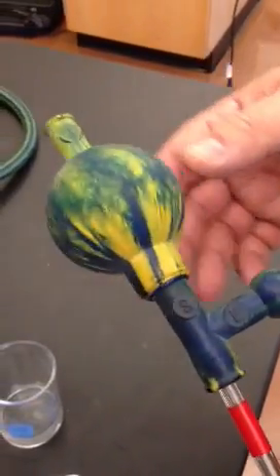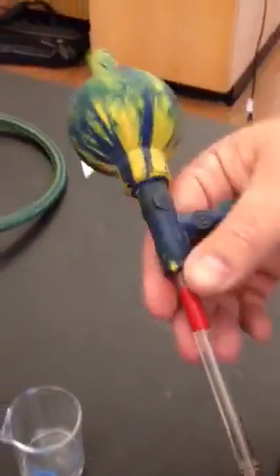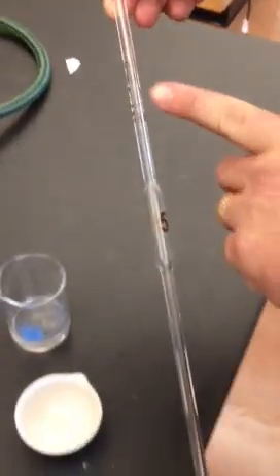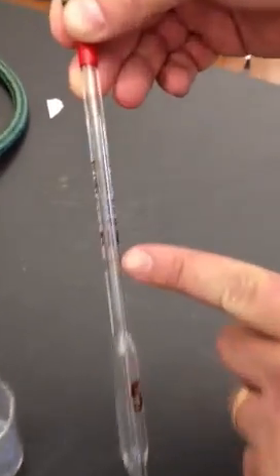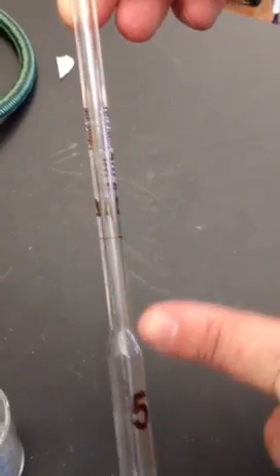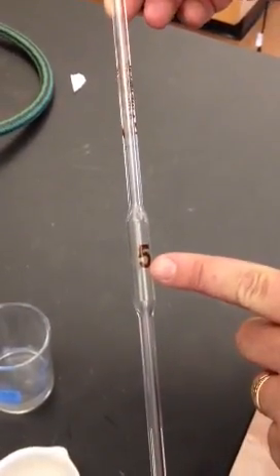Now we're going to learn to use our pipette. The top part here is the pipette bulb. The glass here is the actual pipette. We're trying to get the liquid to the small brown line. This particular pipette is a 5ml pipette.